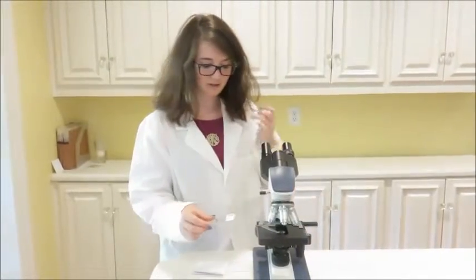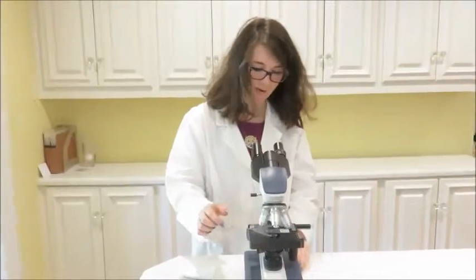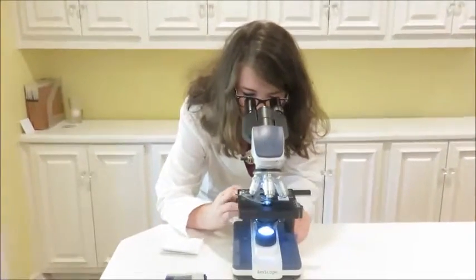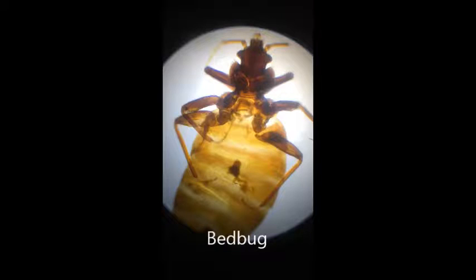So let's take a look at it under the microscope. This one again is pretty big, so you should only need to use the scanning power for it. And then we'll use the knobs again to adjust the focus so that we can see it nice and clear. Sleep tight. Don't let the bed bugs bite.